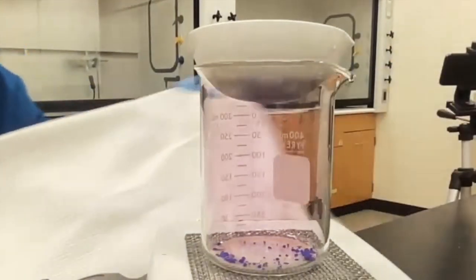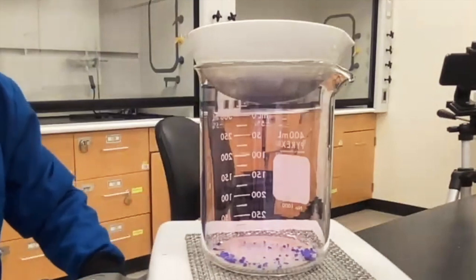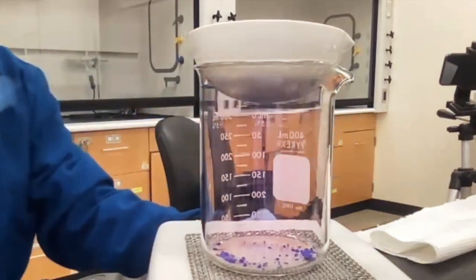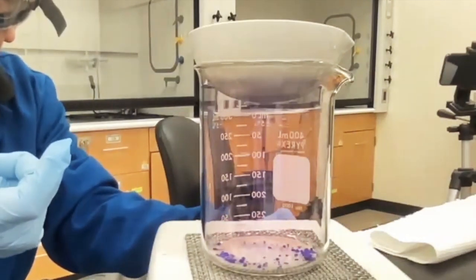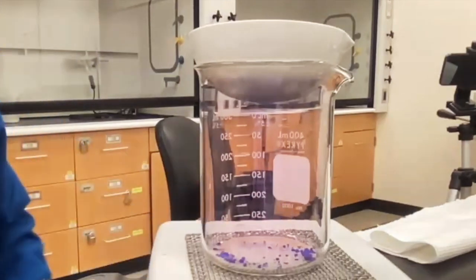So we're going to let this go for a little bit more until that purple gas clears up, and then I'll show you the bottom of the evaporating dish. And then what we do with this one right here. The bottom of the evaporating dish, if you look at your lab manual, is going to be product A. You need to identify product A, okay? So let this go for a few more minutes.